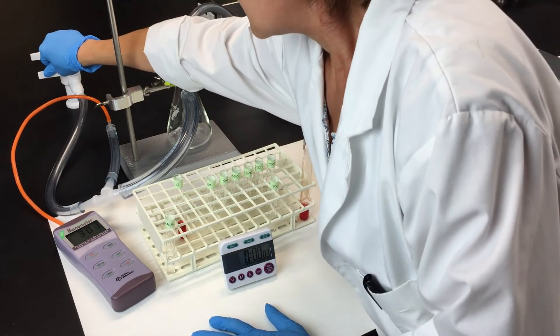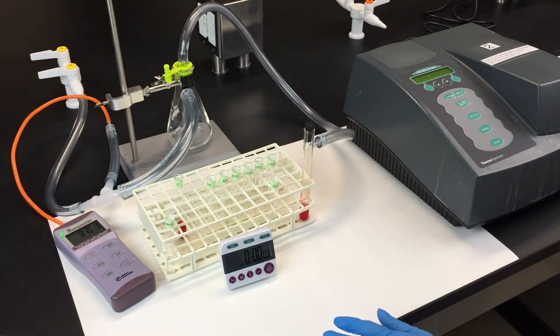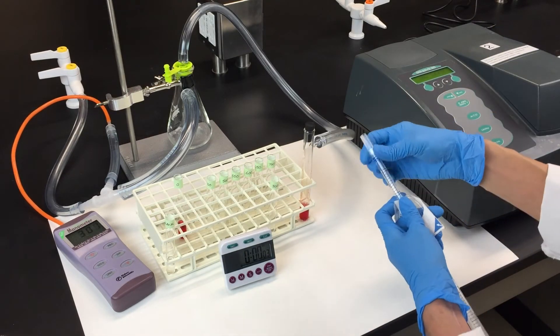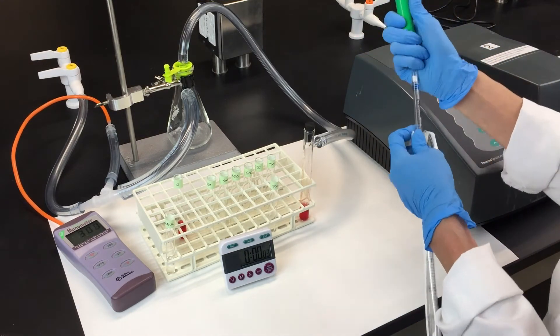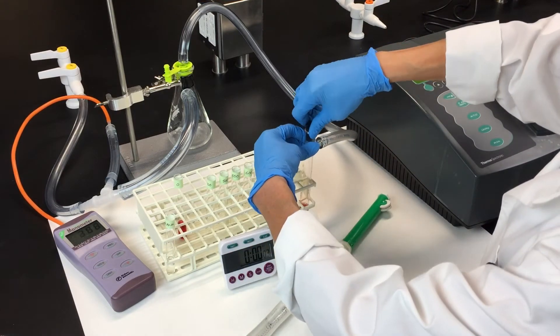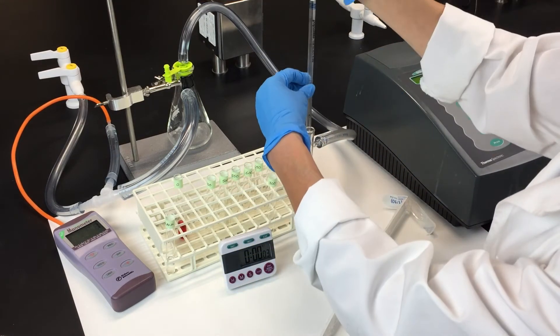After 5 minutes, turn off the vacuum and transfer the hemolysate to the 300 millimeter mercury tube. Do this quickly and try not to get any air bubbles.